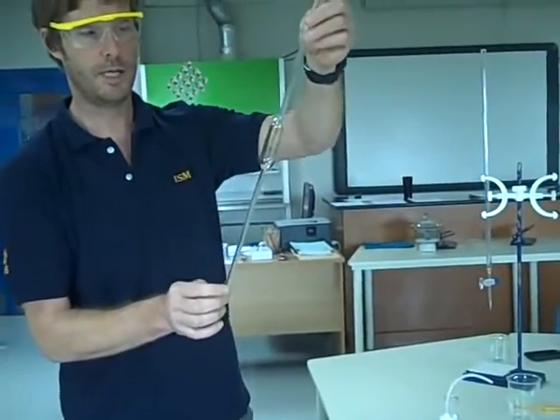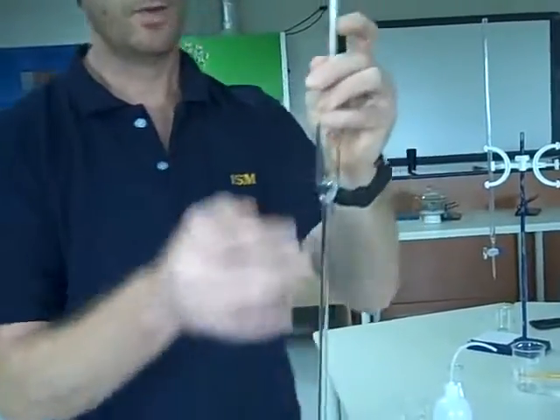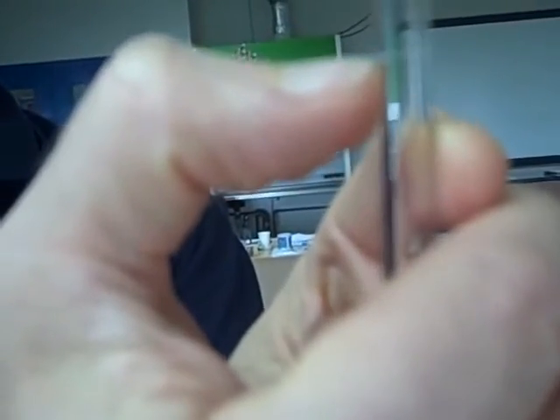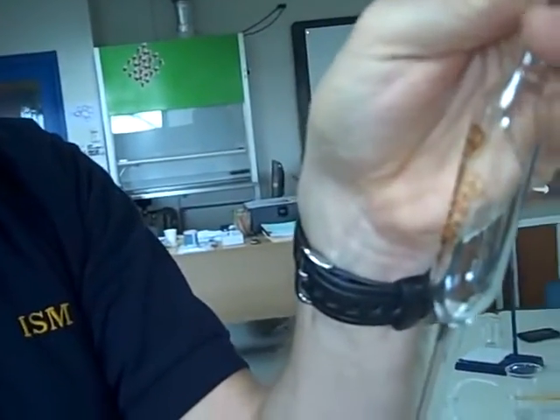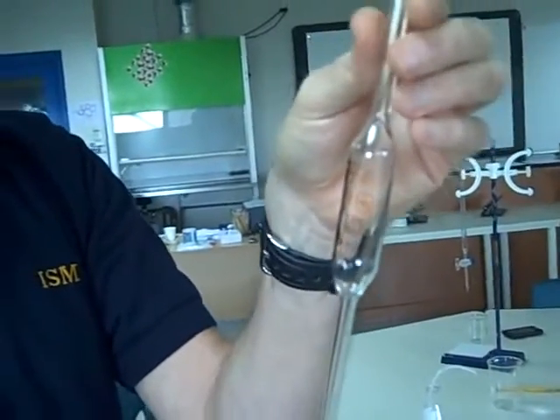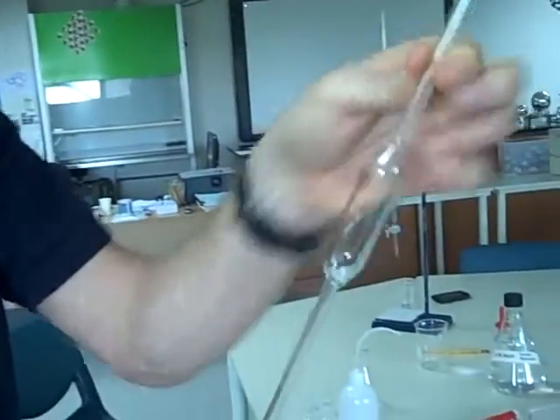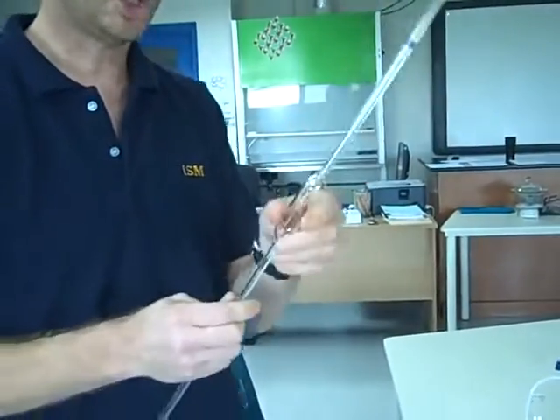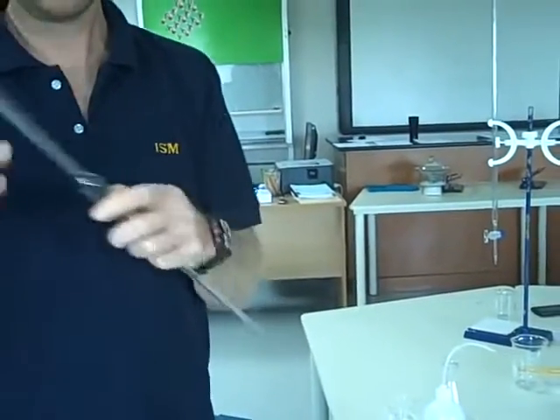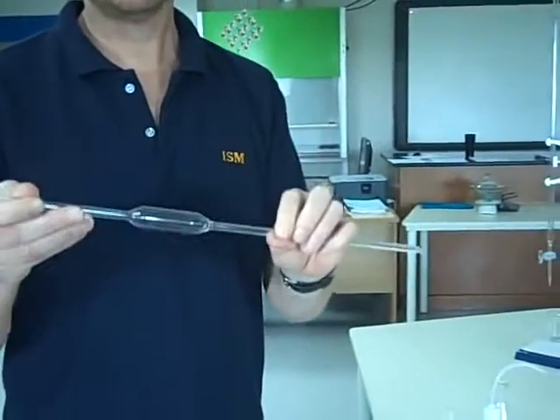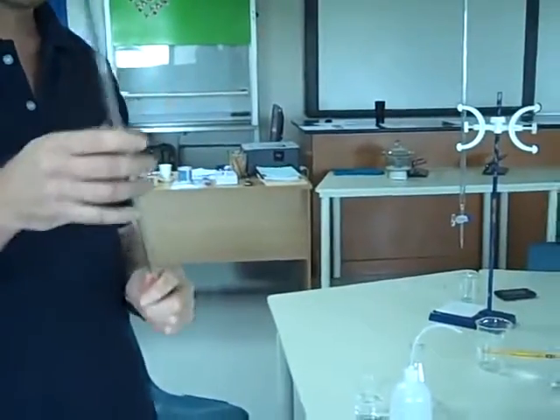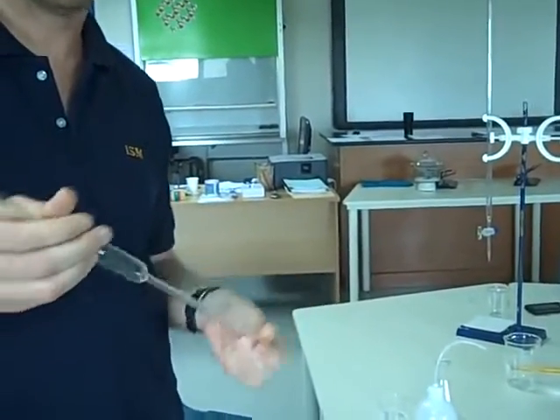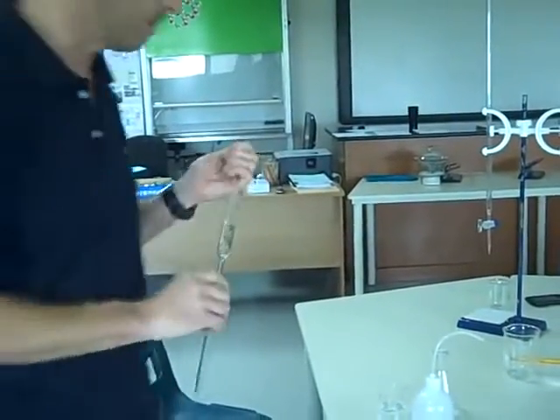My pipette now, this is a 25 ml pipette. Again, this, if we measure up to our graduation mark here with the meniscus on it, will have a precisely known volume of 25.00 cc's, four significant figures. This needs to be clean and dry, or it needs to have been washed with distilled water, sorry, tap water several times, distilled water, and then to get rid of the distilled water, we could wash it through with a little bit of our sodium hydroxide solution. I'm going to work on the premise that this is completely clean and dry.